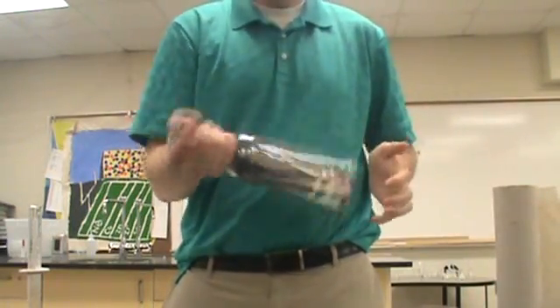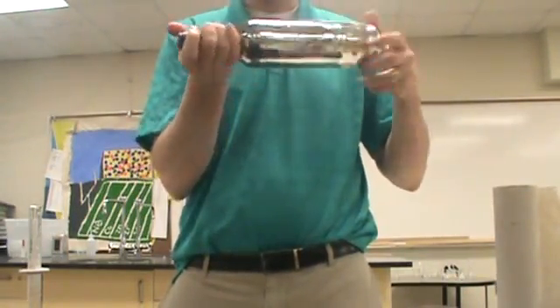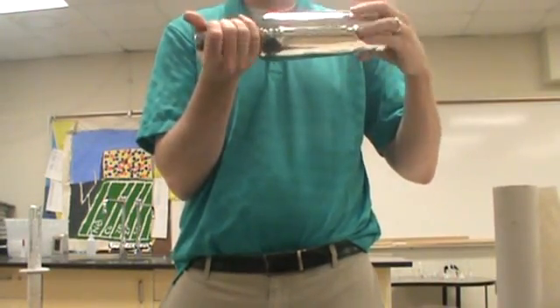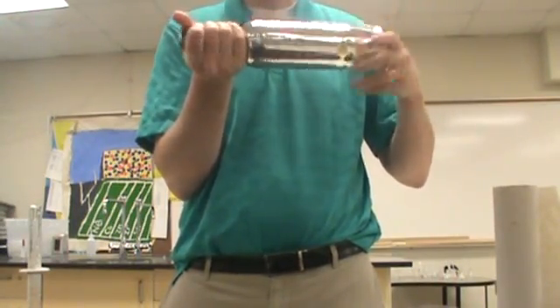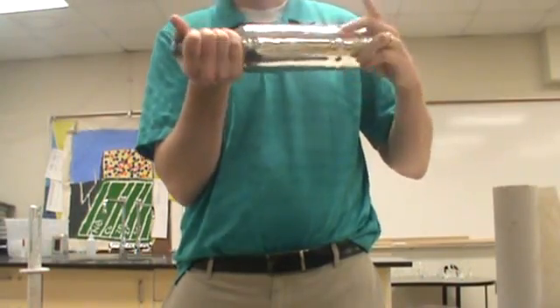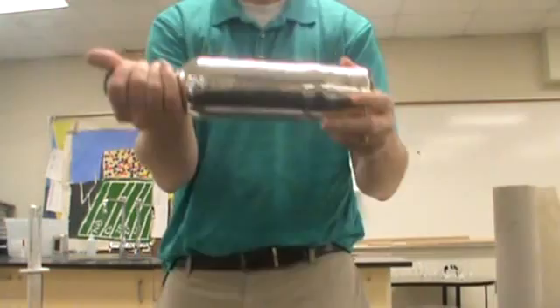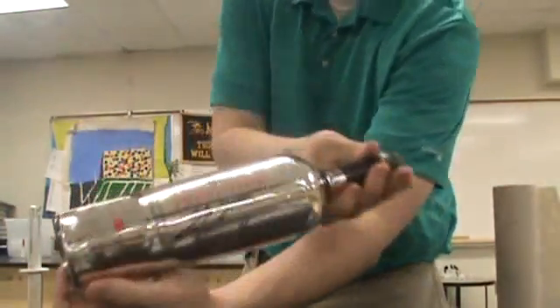The trick that you want to do is you really want to give it a good shake every once in a while. And that agitation kind of gets you a really, really nice clean glass look. Just for whatever reason, it kind of gets more chemical contact, or I don't know, but you can already see that looks really nice right there.